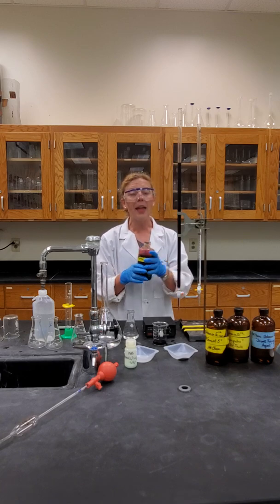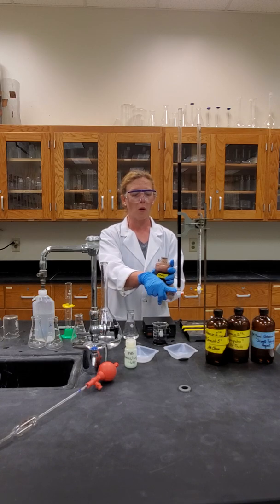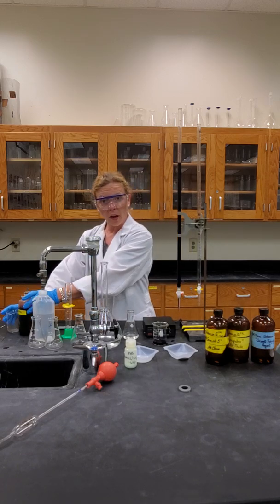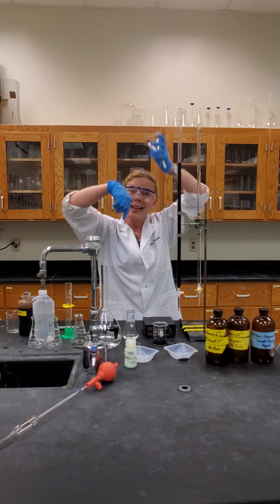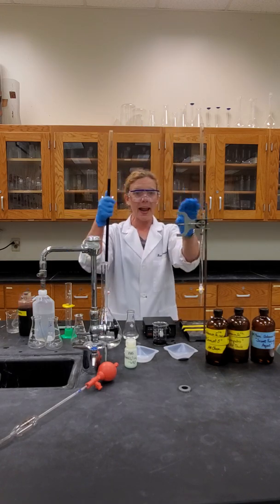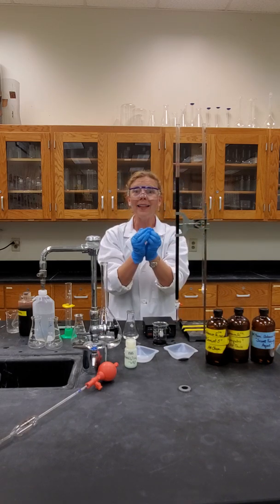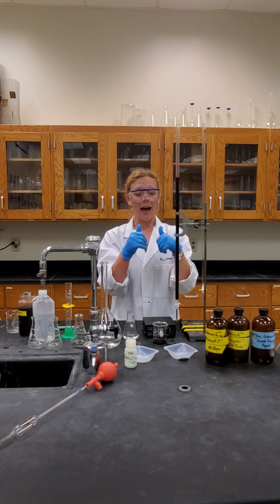Whenever you are preparing your burette, you need to do three washings. Please make sure that you pass the potassium permanganate solution through the spout. I encourage you to have a waste beaker to catch overflow. You can use a funnel to pour in any excess potassium permanganate solution, or you can loosen the burette at any time to add more. Make sure you are reading it at eye level, and do not read it until you've passed liquid through the spout to ensure a constant column of liquid.